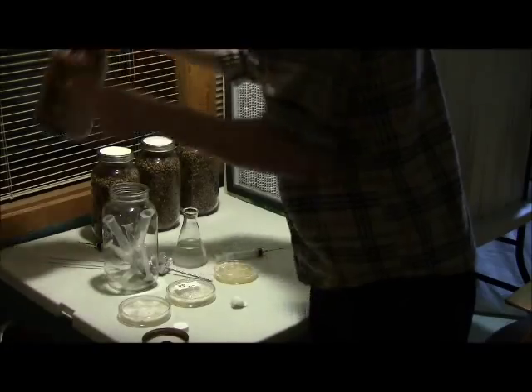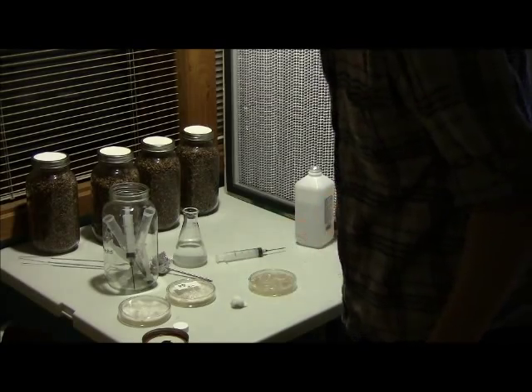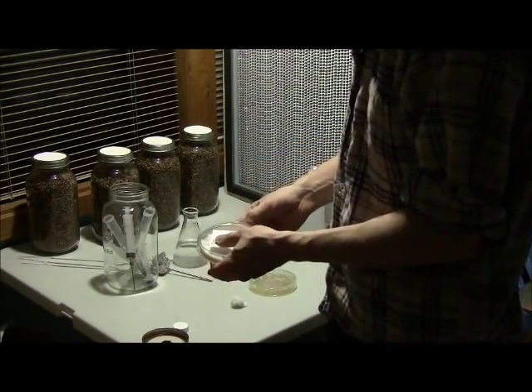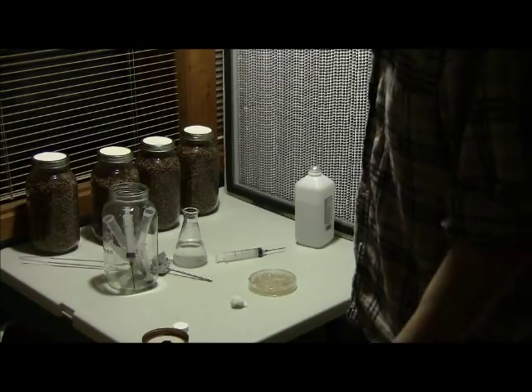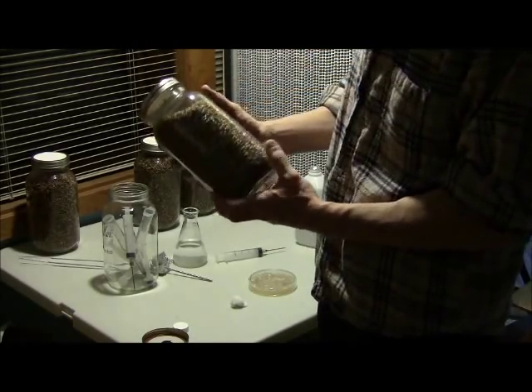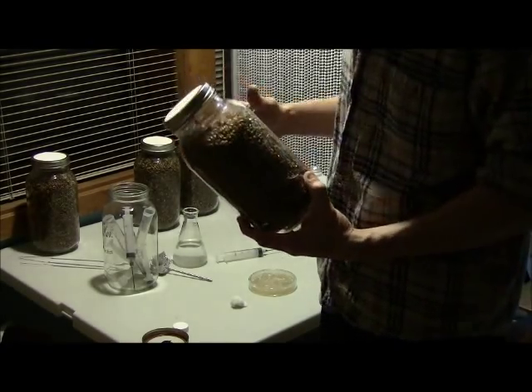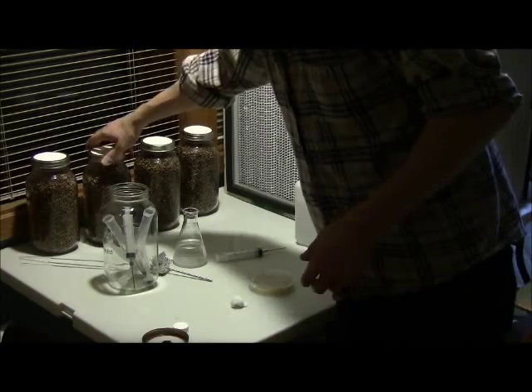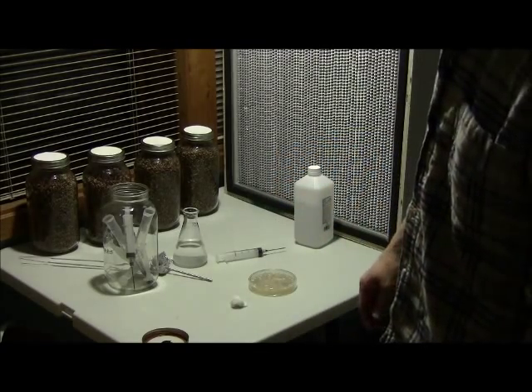You can watch it turn in a circle in there. I'll pitch this used petri dish — I still have seven more good petries to work with. So now I have grain spawn inoculated. Give it probably about two weeks and we should have something similar to that other grain spawn, and we may even see something quicker. Usually it's somewhere between seven and fourteen days — each grain is just a little bit different. That's kind of it in a nutshell. Hope you guys got something out of that.